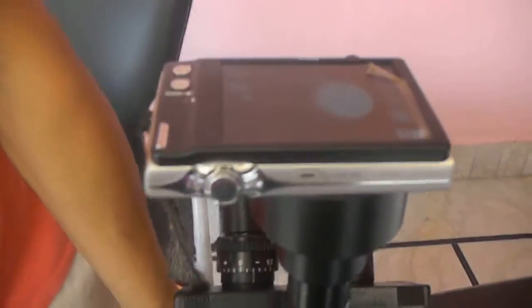Now after putting, focusing will be done. When you see this image is coming here. Now the focusing is done by focusing knob. We can do focusing on both these things. We can focus from eye and then let me focus it.